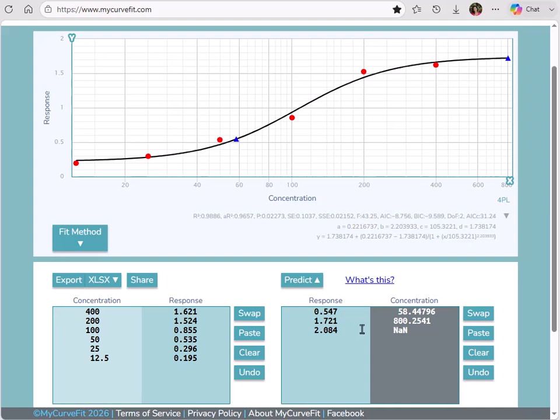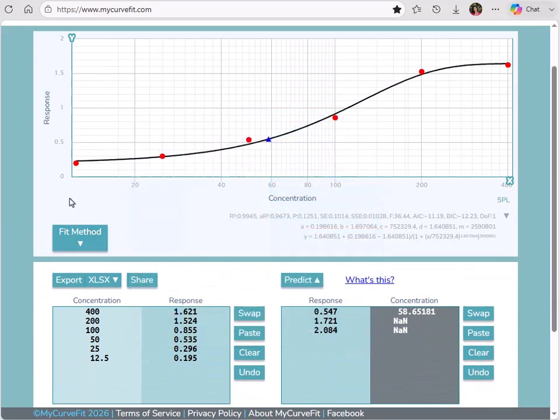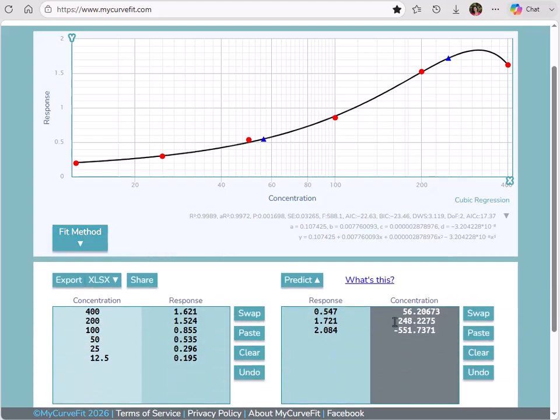Now let's look at how different fit methods handle this data set and the resulting prediction points. First, let's look at another sigmoidal fit, the 5PL fit. Applying this fit method shows that we're unable to extrapolate our second prediction point, the one slightly outside the range of the standards. Applying a polynomial fit, such as a cubic regression, shows extrapolation for our second prediction. However, you can see unstable behavior outside the range of the standards. For example, this curve features a turning point where any samples with response values in this range could return 2 possible concentration results. Next, let's look at a cubic spline.